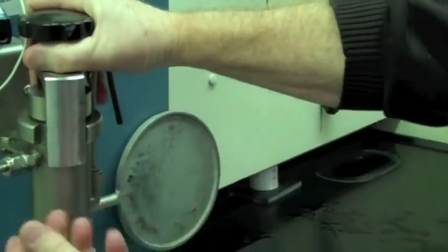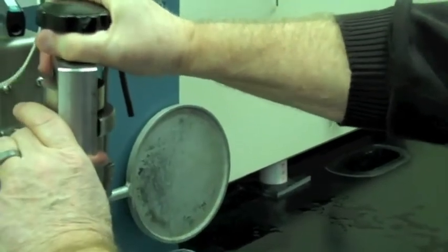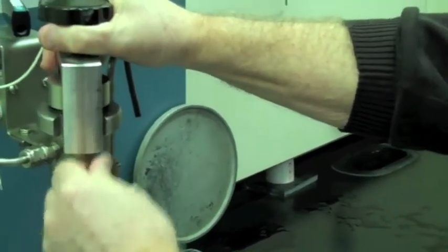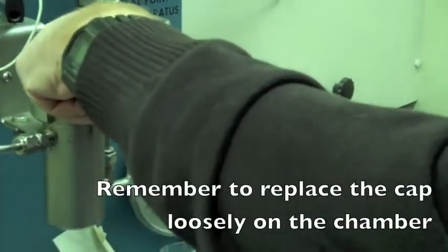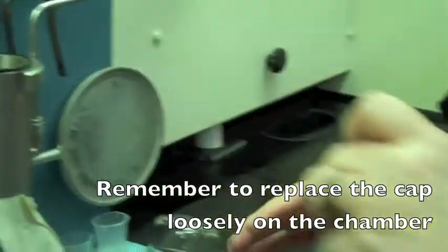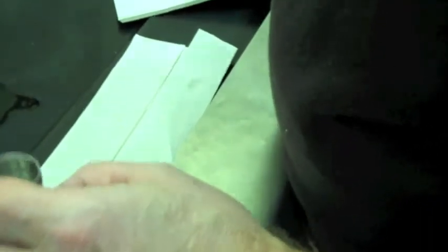And now that O-ring in there swells a little bit, so you may have to use some thumb pressure to get it out of there. And everything should be hunky-dory and dry in there. And this one comes back on. Getting rid of all these.